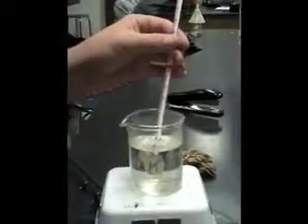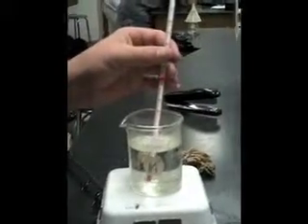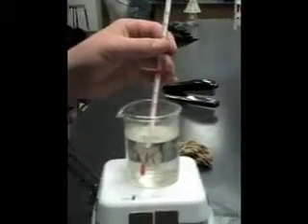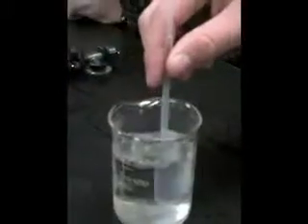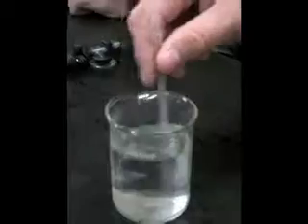For the last time, we are recording the temperature of the water at 75 degrees Celsius. Now we have to swirl the upside down pipette in the hot water for 1 minute. 27 drops at 75.2 degrees Celsius.